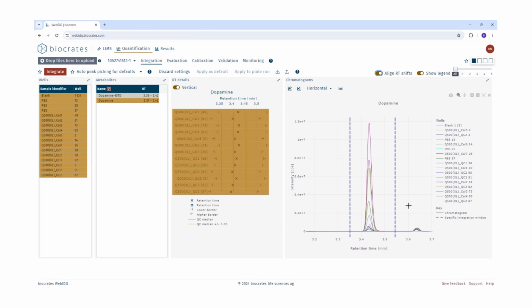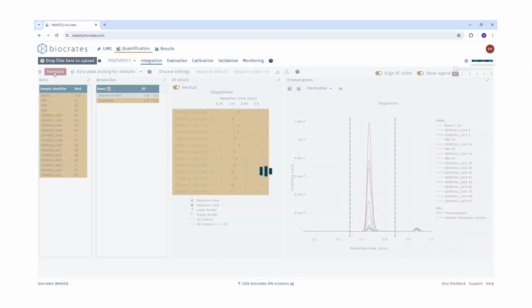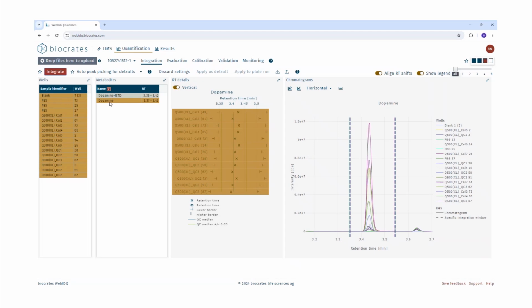So with this new feature in WebIDQ, peak integration for a complete plate in case of retention time shifts or matrix effects can be performed hassle-free and is much faster and easier, which was previously very time-consuming, or it was almost impossible to define the integration windows for each well separately for all the metabolites. Once you are satisfied with all the integration windows of a plate run, click on Integrate. In this case, integration of all the peaks of a plate run is performed. After integration is completed, the corresponding indicator in the workflow guidance will turn blue. So we can see that with the first blue box, integration window is defined, and with the second blue box, that the integration is completed. The third box is for calibration, followed by validation.